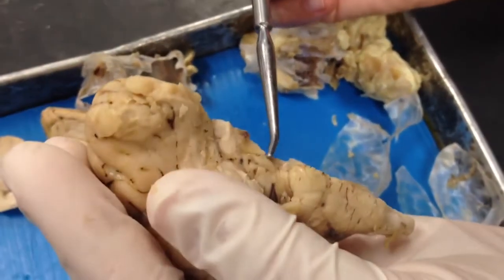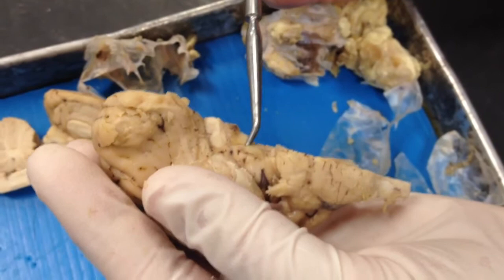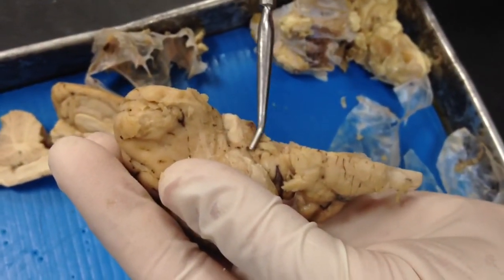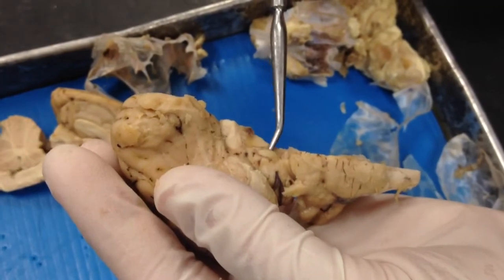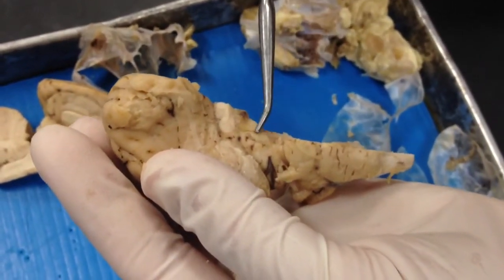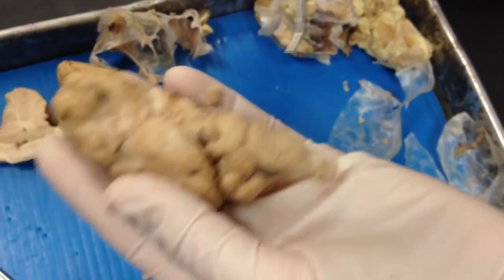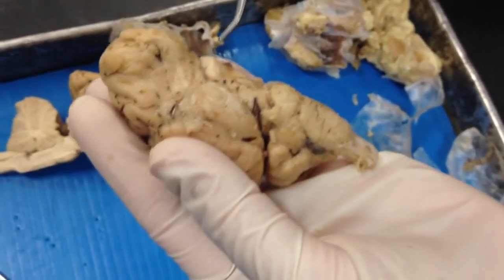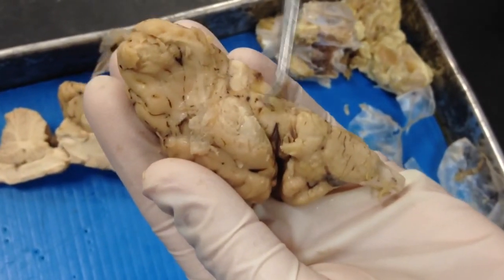What were these structures right here? They were peduncles as well — cerebellar peduncles. This structure is something important.